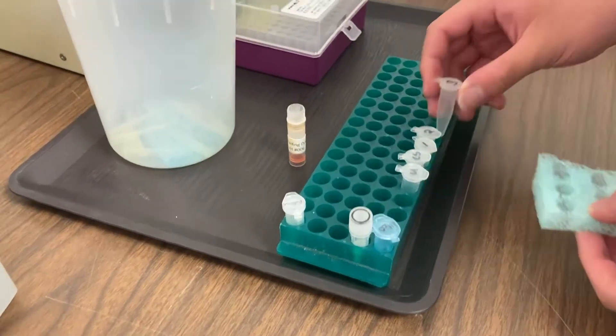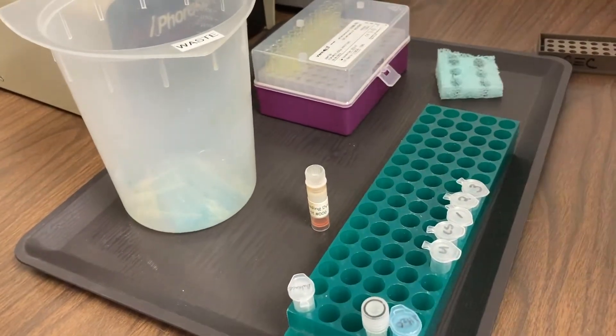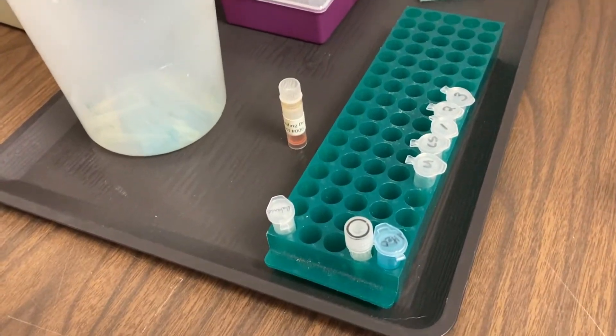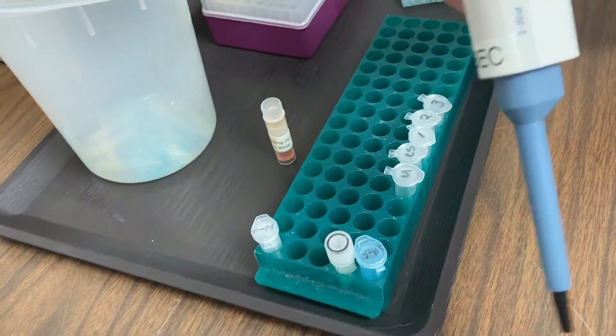This is going to allow us to be able to see the DNA that's been cut in each of these tubes, except for the uncut DNA, of course.